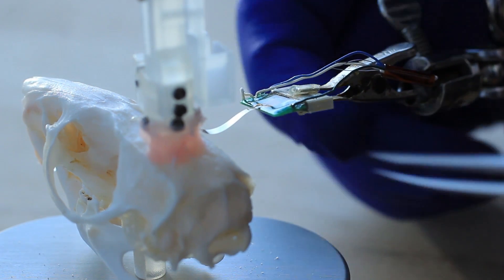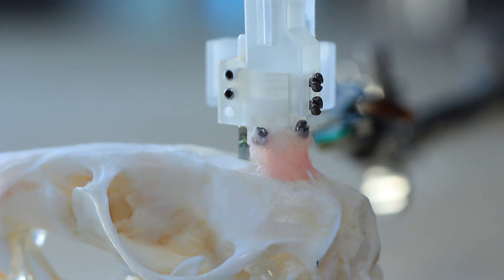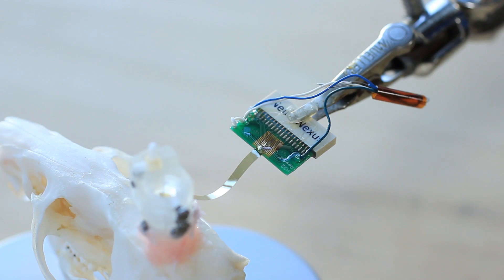Remove the connector and secure it with the third arm, then disengage the stereotaxic adapter. If needed, perform modifications to the ground and reference wires.